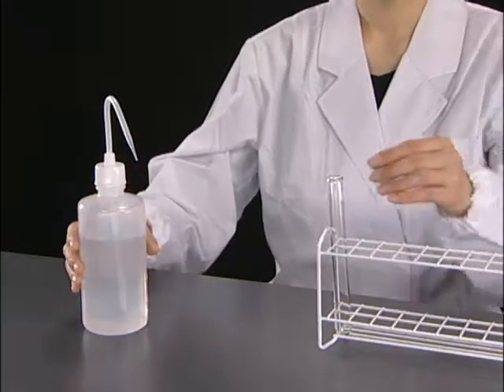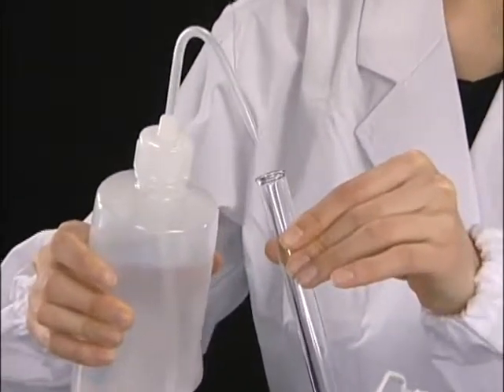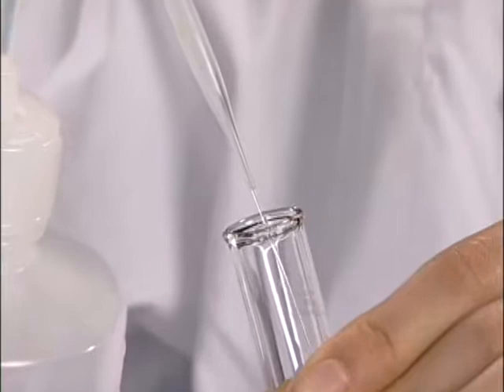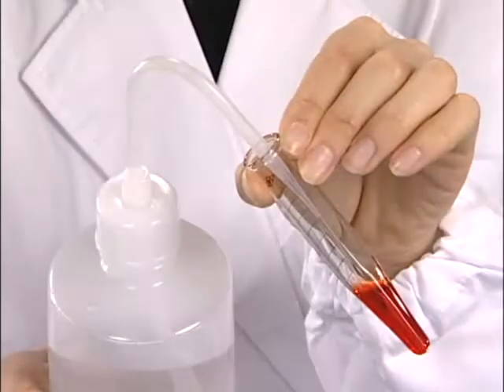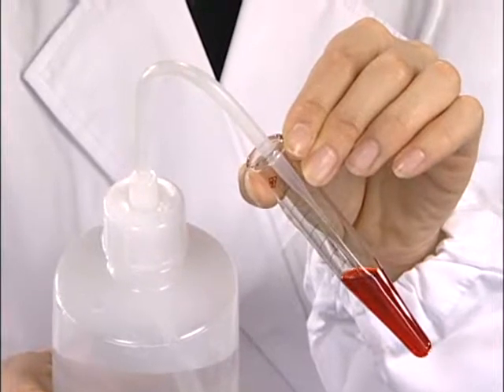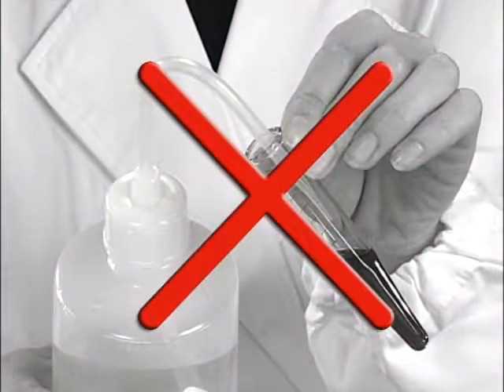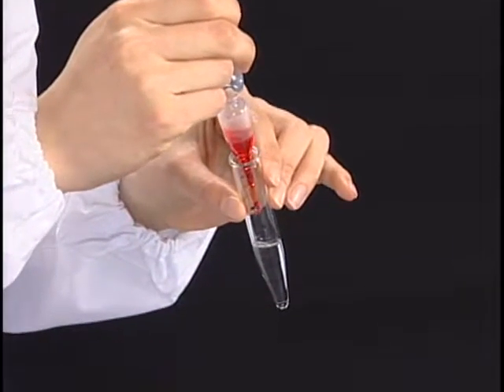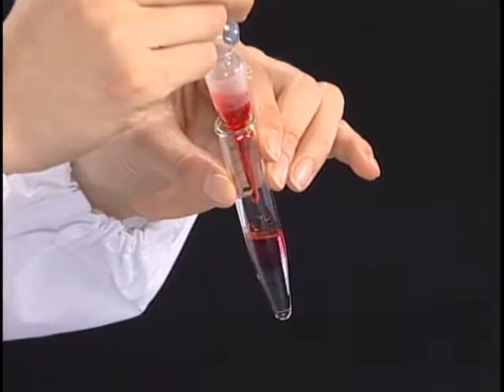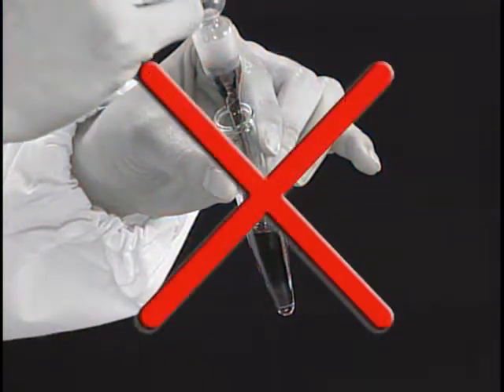Wash bottles are employed through various stages of an experiment, and their contamination may affect the entire experiment adversely. Consequently, don't insert the tip of a wash bottle deeply. Also, don't insert the tip of a transfer pipette in the reagent bottle deeply, as it may cause contamination.